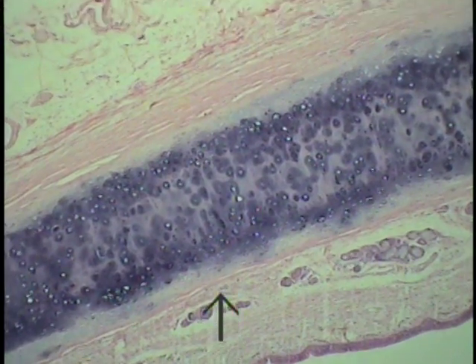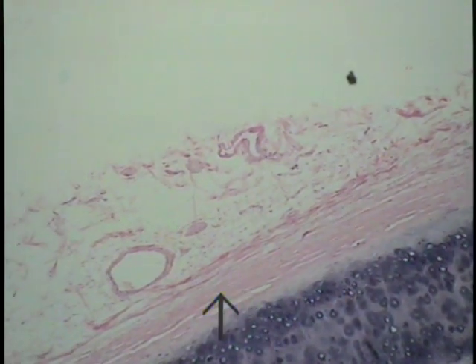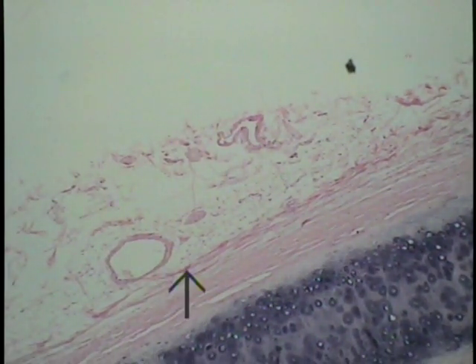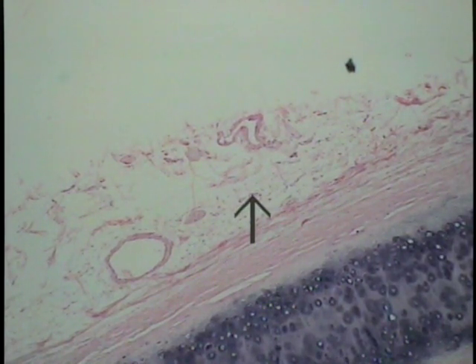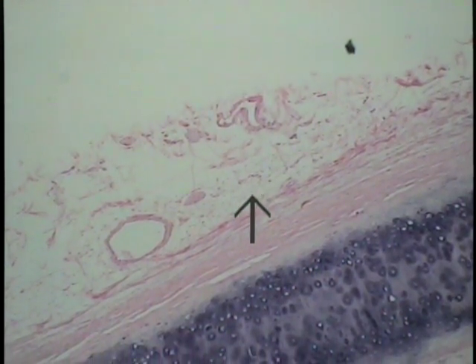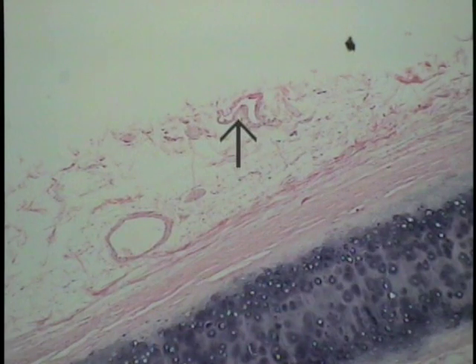And then if we go beyond, in this particular section, the perichondrium, out to here, this is perichondrium, this type of connective tissue is the remnants of the outerlying adventitia, which is going to anchor this particular organ to adjacent structures. It'll oftentimes contain small nerve bundles and vessels of various sizes.